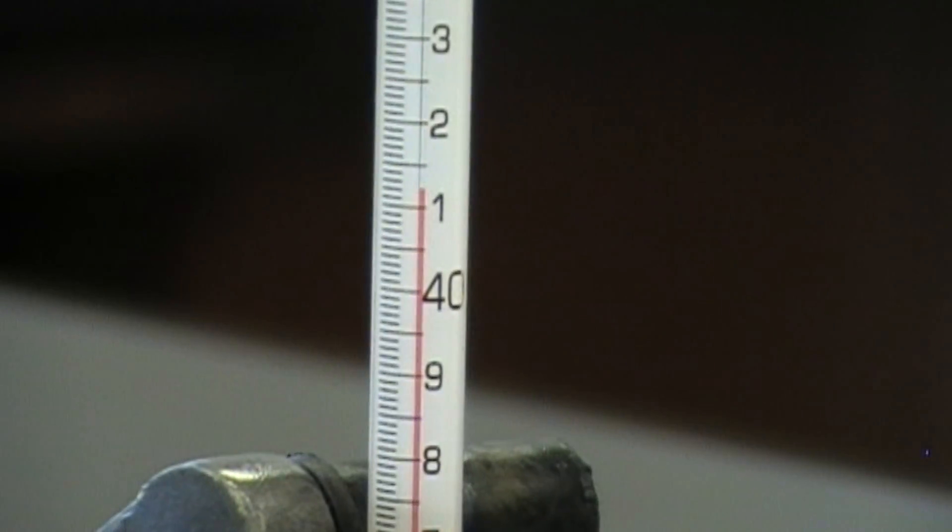As you can see, the temperature will increase rapidly, so be prepared. Quickly and precisely record your data.